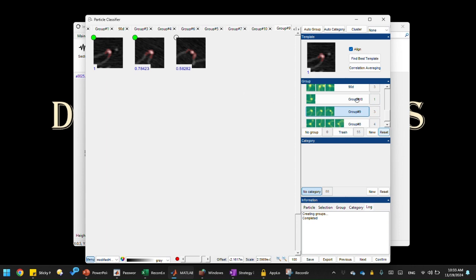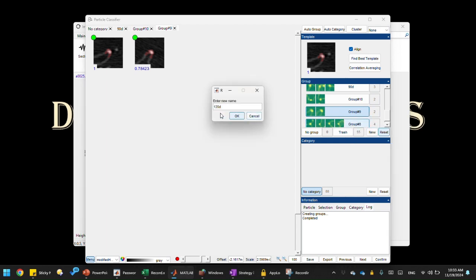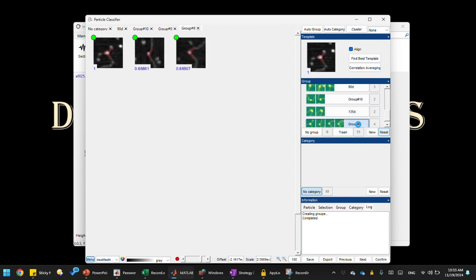These are the hard ones because of the way it is masked. I mean, there's no way to automatically classify. This is 135 degree. Let's do this. And finally, we have group 8. Yeah, that's another sharply bent state, above 90 or close to around 90, I would say. So 90 degrees.